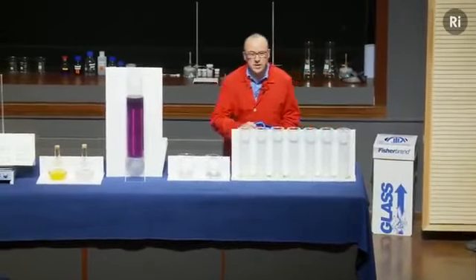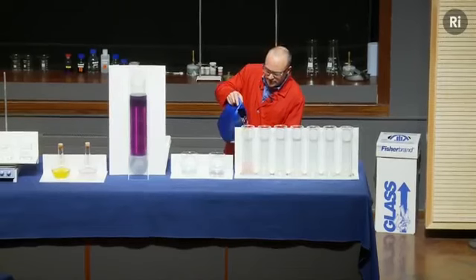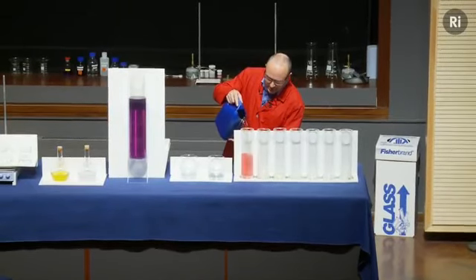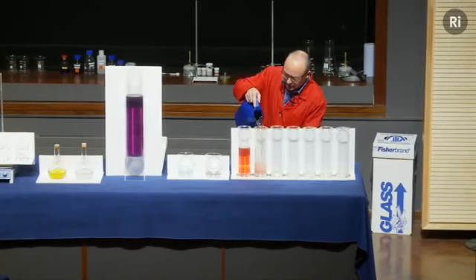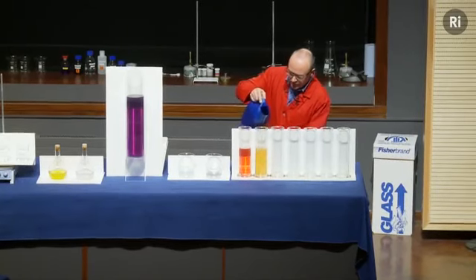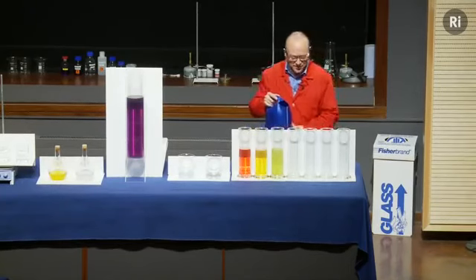I'm going to start with the liquid in this container, and I'll just pour some into this cylinder. So you can see it's a nice bright red colour. But let's see what happens if I keep pouring. Well, I think you can see every time I pour out the liquid, I seem to get a different colour.